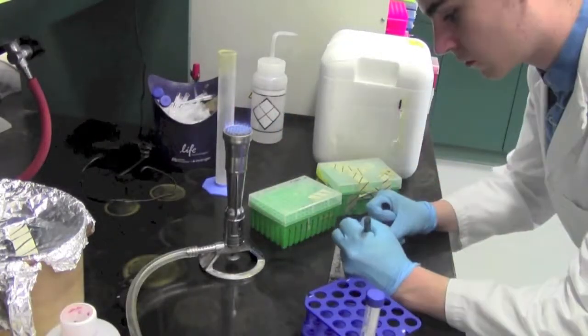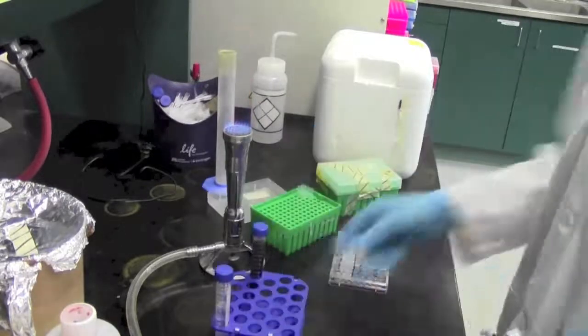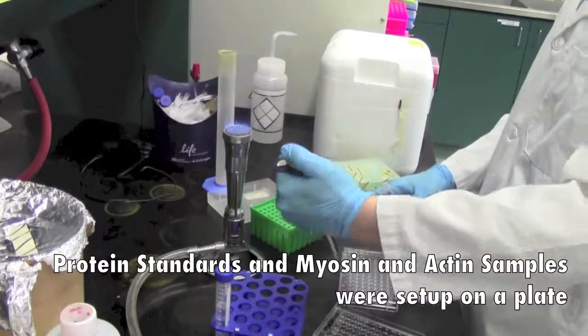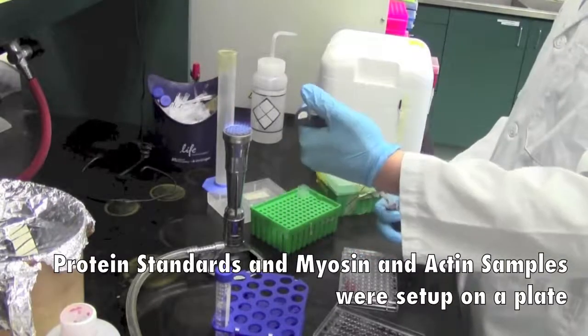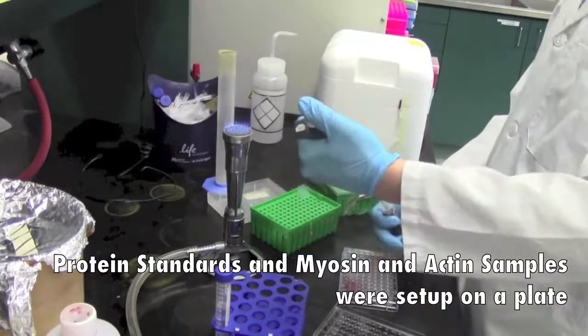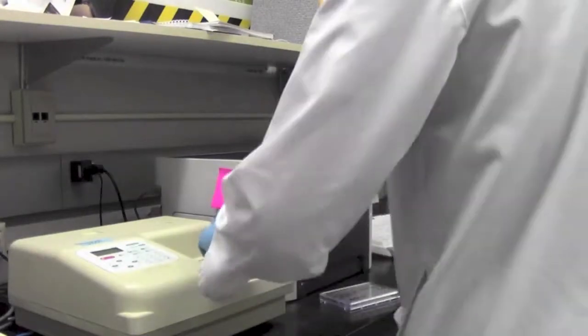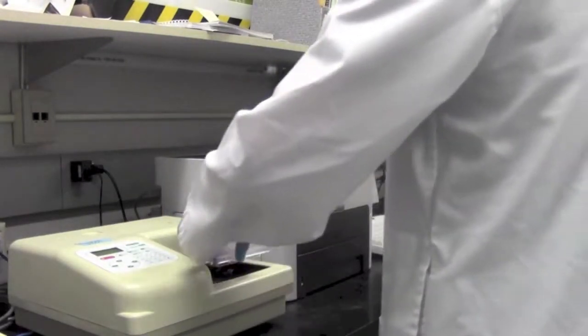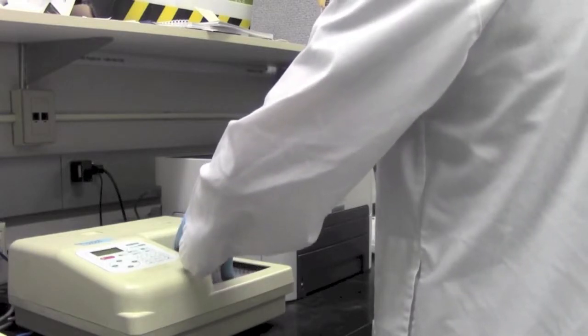So finally, the products from the myosin and actin extraction were set up on the micro-titer plates and were mixed with the appropriate ratio of Bradford assay dye. After 10 minutes of incubation, the micro-titer plate was placed through an optical density scanner at 595 nanometers.